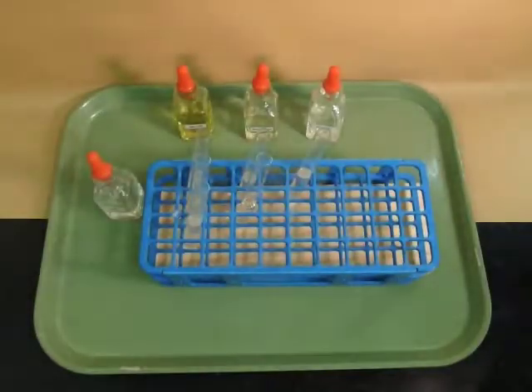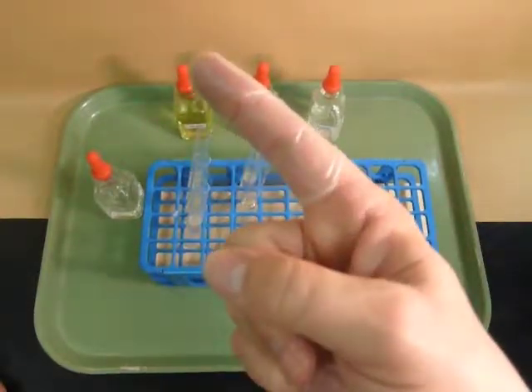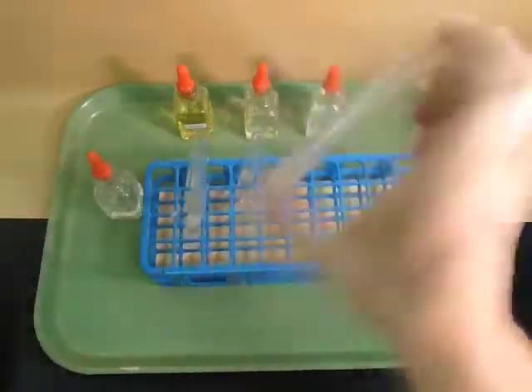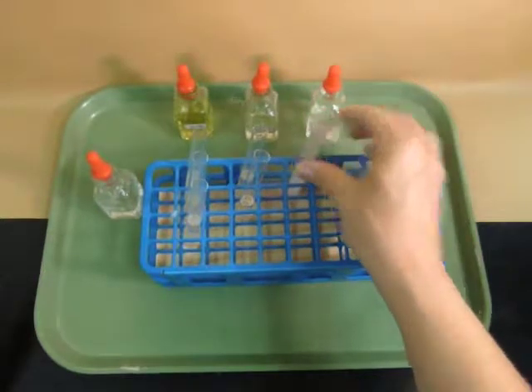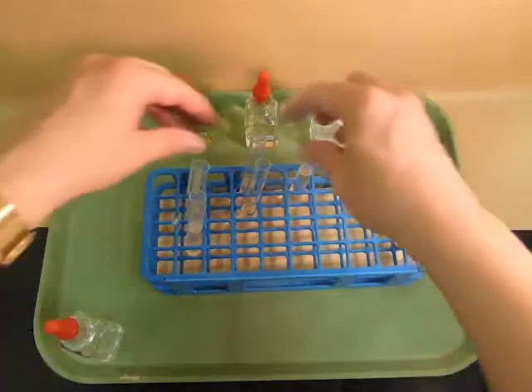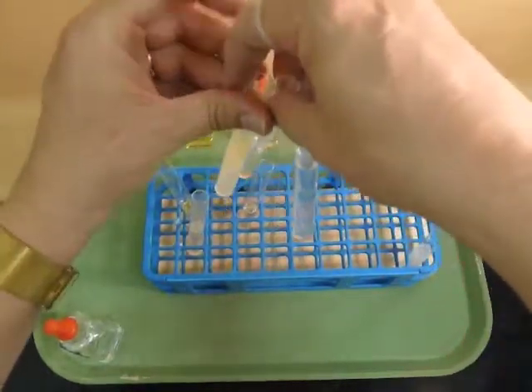And then what you want to do is you want to take a covered finger, I put the part of a glove on my finger, and cover each test tube and shake it up and then let it sit for a while to see if things remain mixed or if they separate into layers. And then we'll record the data to see what happened. So I'll show you the first 3 tubes and we'll see if they form layers or not. Let's move the camera up.